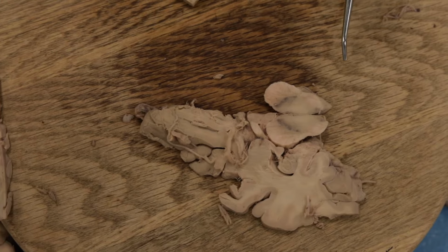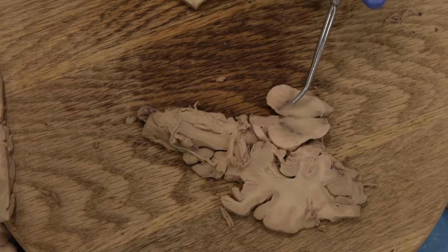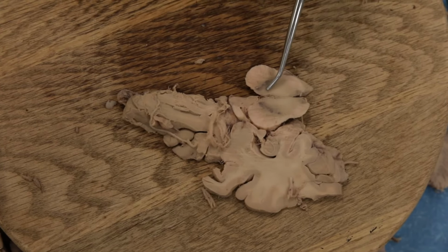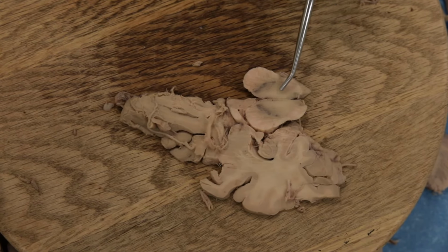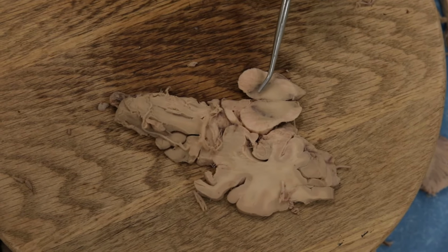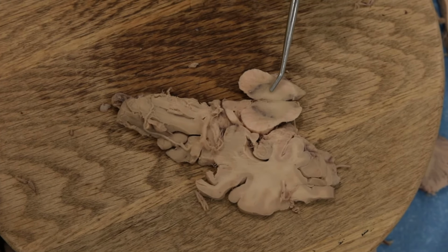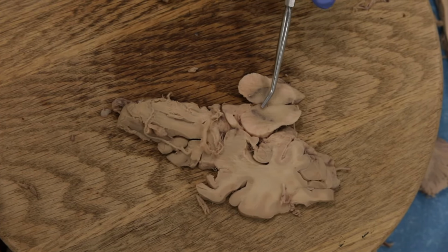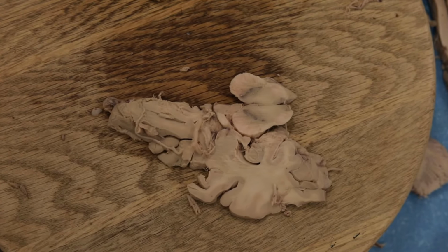Now we're just below the red nucleus, and if you can appreciate, there are some white matter pathways right here. This is called the decussation of the superior cerebellar peduncle. This will make sense when we do the wiring pathway diagram of the cerebellum. But when the cerebellum talks back to the motor cortex, it sends that information through the superior cerebellar peduncles. And these cross, so the right and the left cerebellar information crosses right here in the midline. That's why it's called the decussation of the superior cerebellar peduncle.